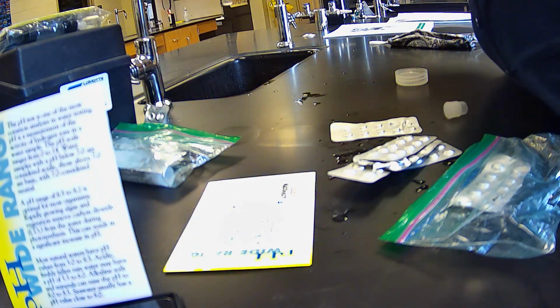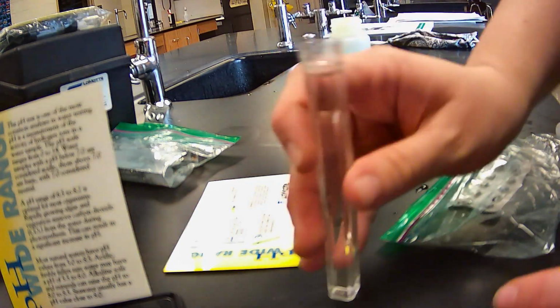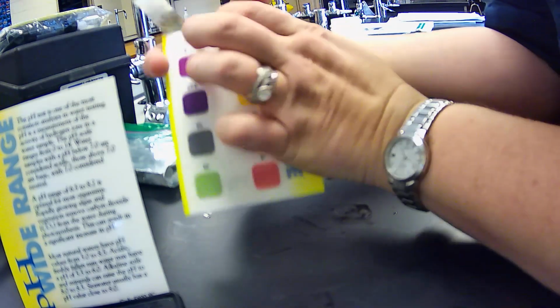All right, so we're going to fill the test tube to the 10 ml line. Oops, a little too far. All right, perfect. So we're at the 10 ml line, and we're going to add just one of the pH tabs there. Beautiful. Okay, and we're going to cap it and mix until it has disintegrated, and that one did not take long at all. Beautiful. Now these results are immediate, so we're going to take our scale here.